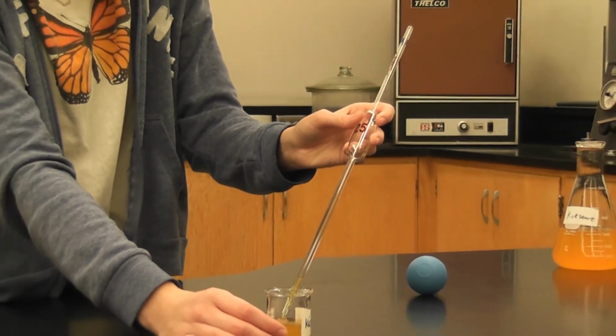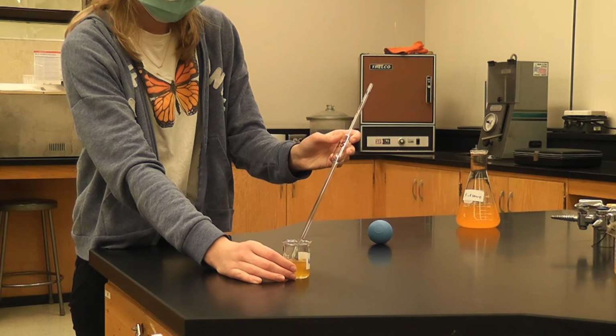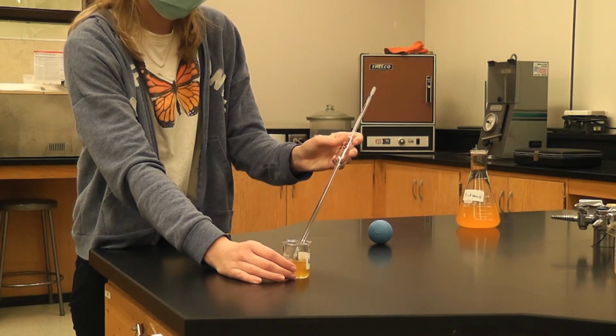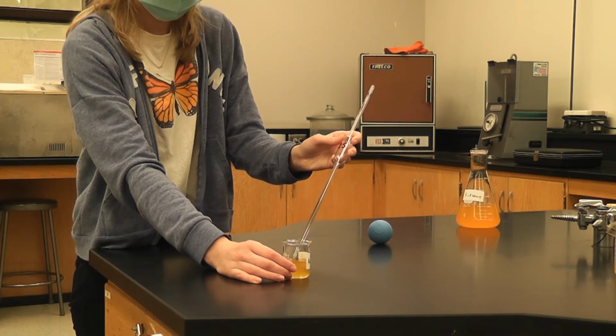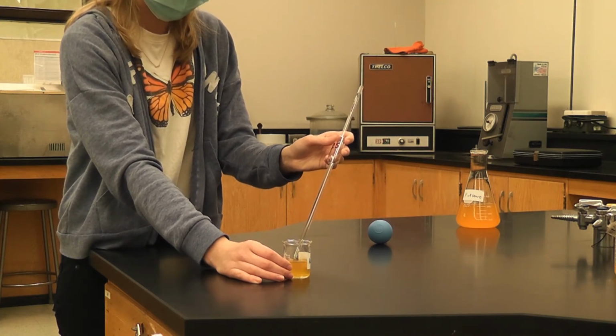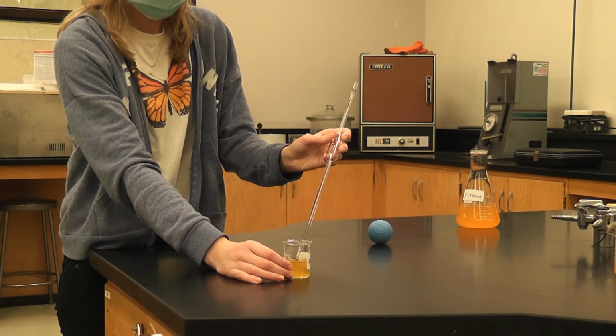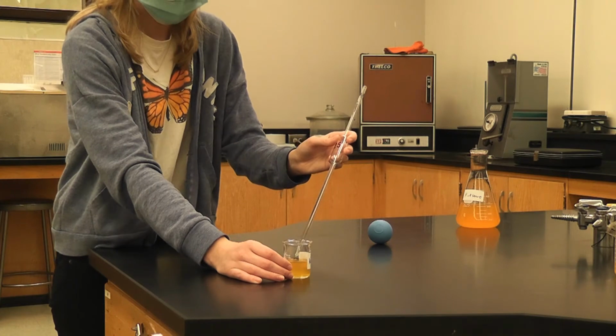Okay, so then it reaches the tip and we wait 30 seconds. Approximately.